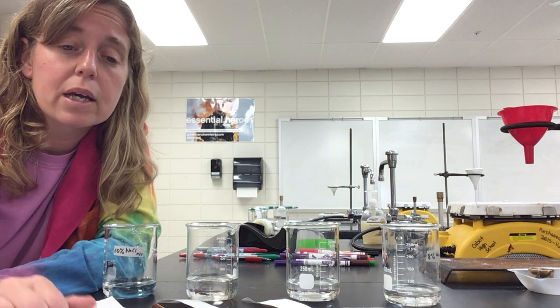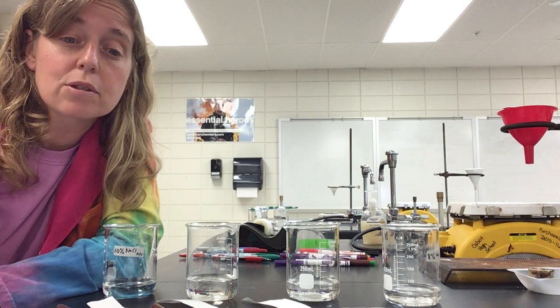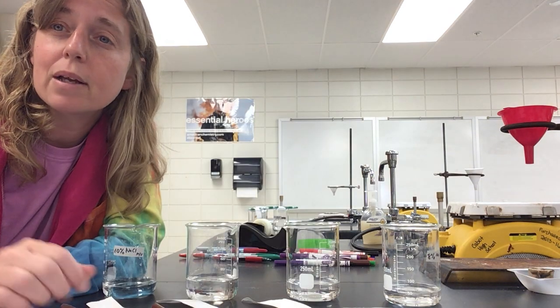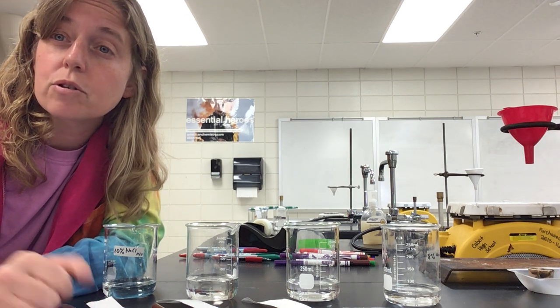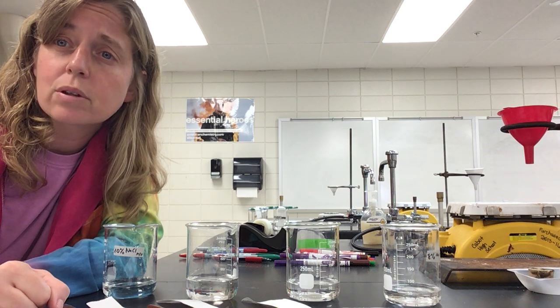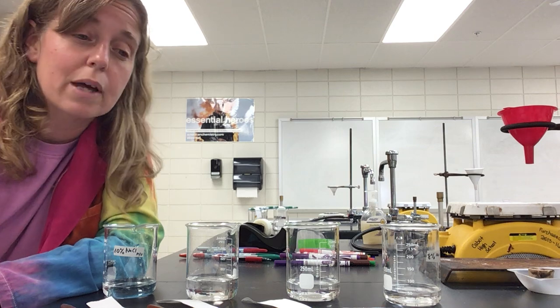So the basis behind paper chromatography, it is a way to look at complex mixtures by separating them into their components, okay? So this is the paper that you'll use. Remember, in Google Classroom, it's not going to benefit you to just go to the assignment and try to do the assignment. Remember, you have to use my Google Interactive Slideshow because all of my videos are going to be embedded in there. So this video that I'm showing you right here, when you get ready to go answer these questions in the assignment, you're going to have trouble answering the questions because you're not watching the video as it's going along, okay? So make sure you do that.